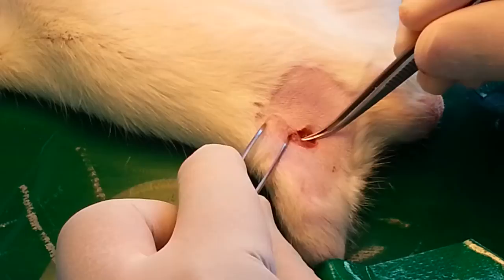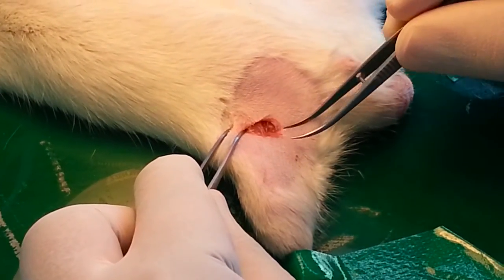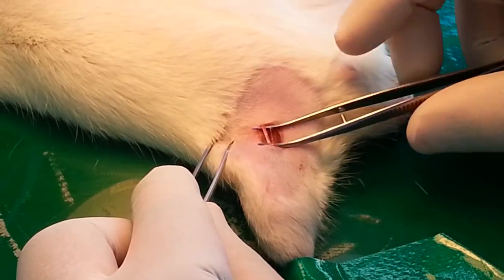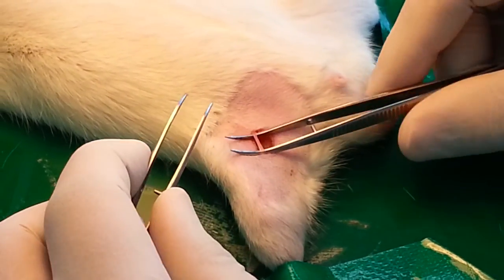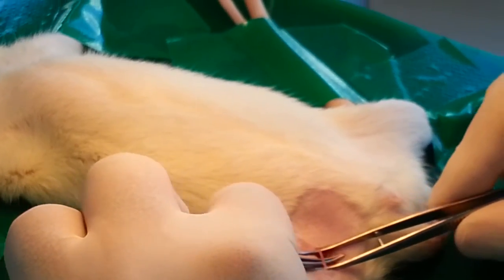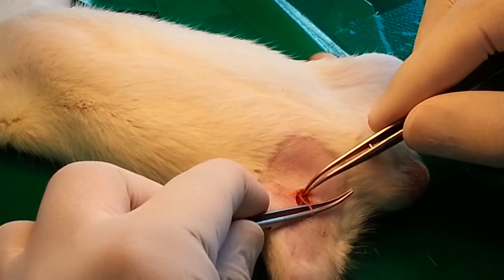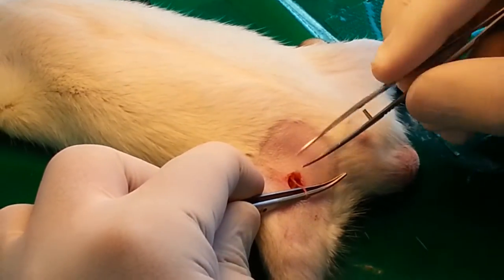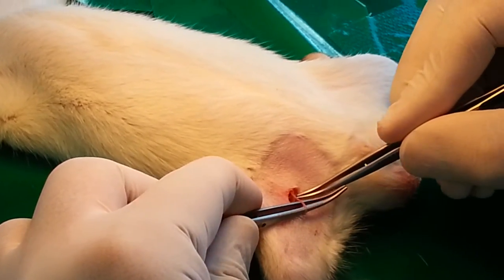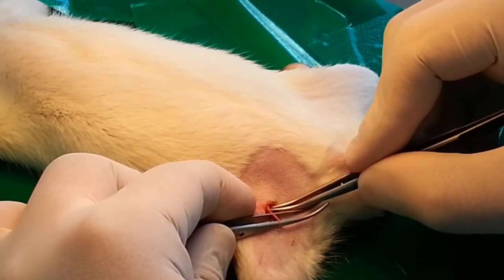One most important thing is that you need to concentrate. Here we go with the artery and vein — finally we were able to get our required artery and vein. But still we need to make it a little more clear. There is a junction here; you need to find this junction because it will help you to differentiate the arteries and veins.